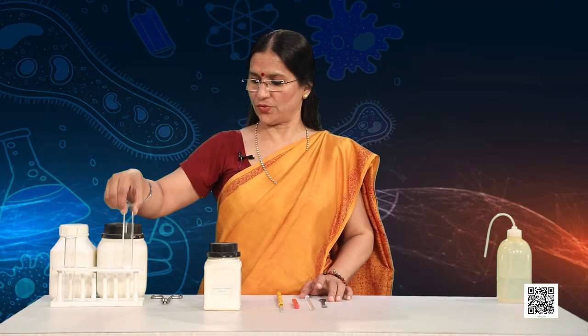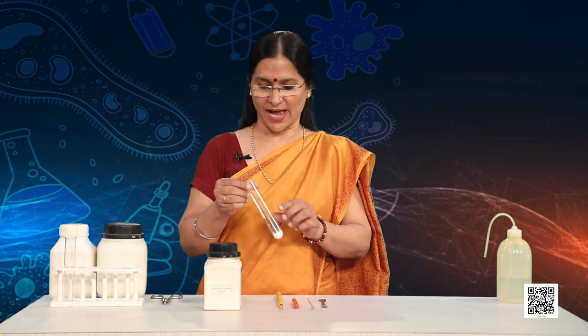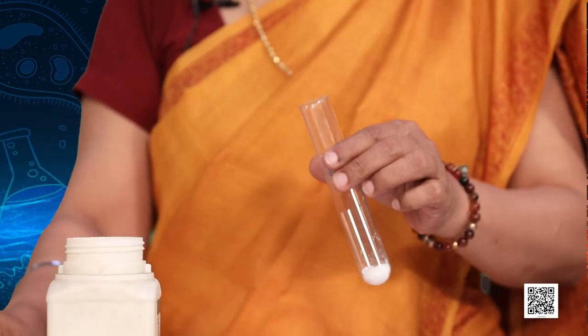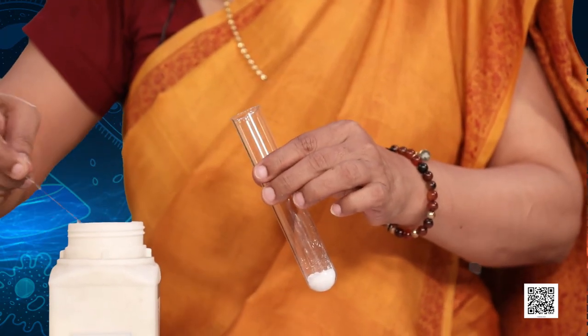Now observe carefully — I will show you an activity and you will tell me whether it is an exothermic or an endothermic reaction. I have taken around 2 g of barium hydroxide in this boiling tube, and now I am going to add ammonium chloride.